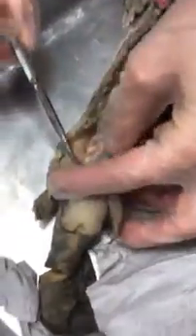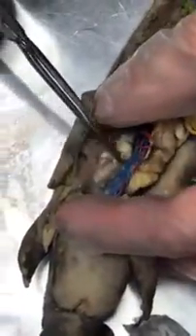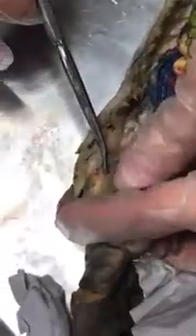And if you find the kidney, you can kind of see it easier on the dorsal side, you just have to find the squiggly white structure where it's not so squiggly, I guess. In this gray area here, you can see very faint pink arteries, so those are the renal arteries. If you pull on the leg, you can see the iliac artery going to the leg.